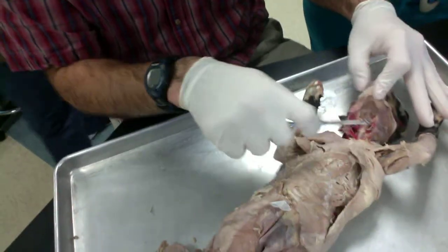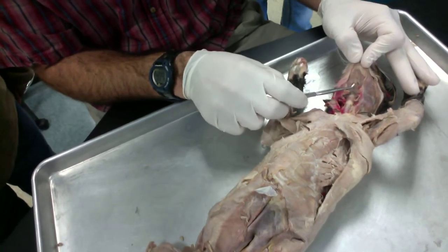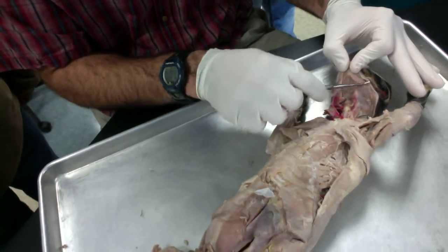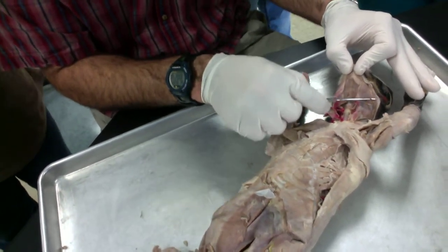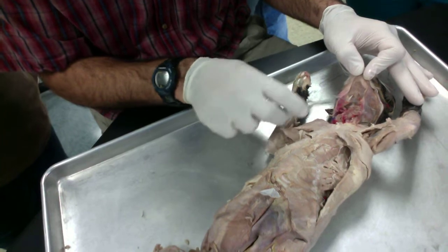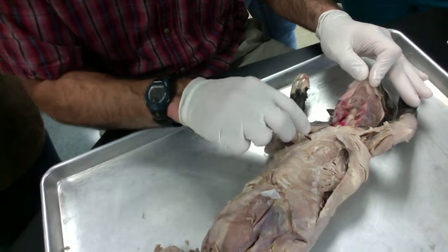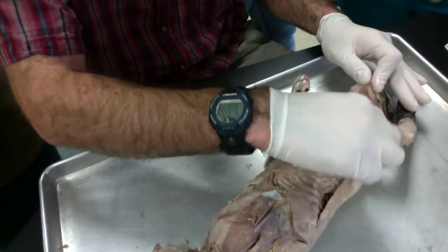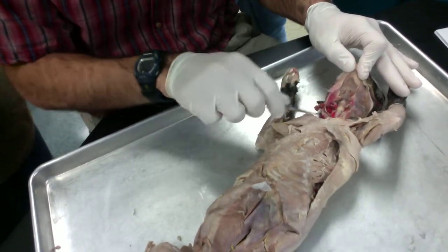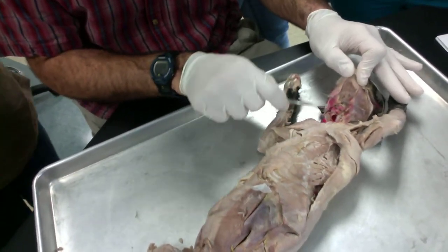Starting with the neck here, our upside down V is the digastric. This muscle between the two in the middle here is the mylohyoid. Here, the cheek muscle is the masseter. This muscle that runs along the surface of the trachea is the sternohyoid. The one that runs along the lateral side of the trachea is the sternothyroid. And then the one that forms a V right here, this one's kind of missing, is the sternomastoid.